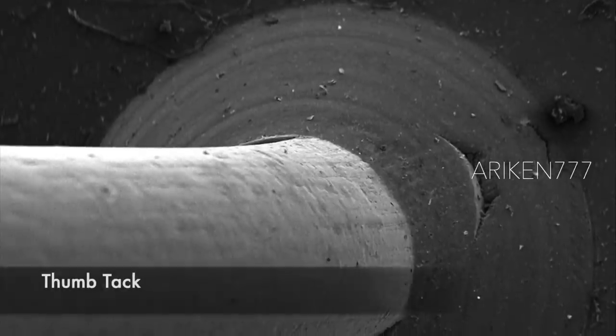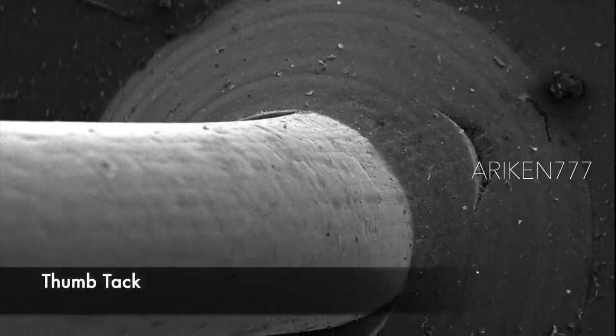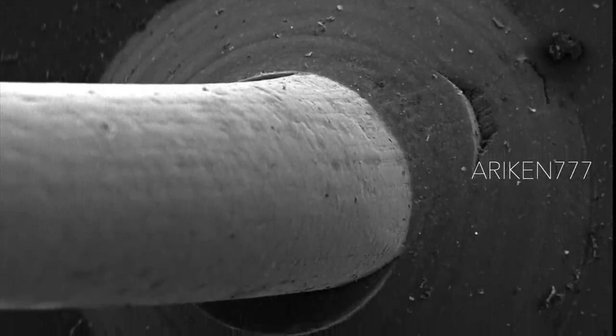A drawing pin or thumbtack, which is used to fasten items to a wall or board for display.